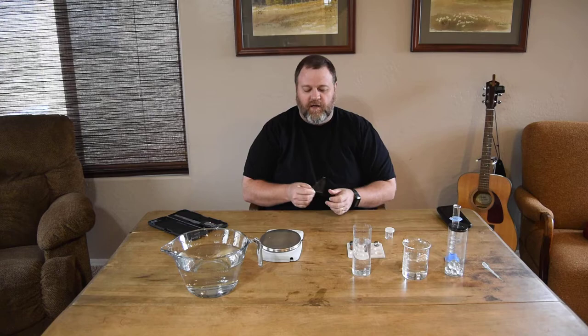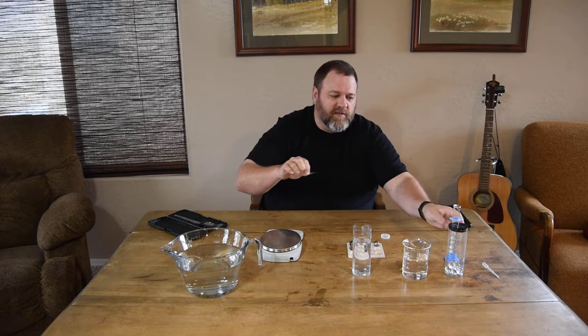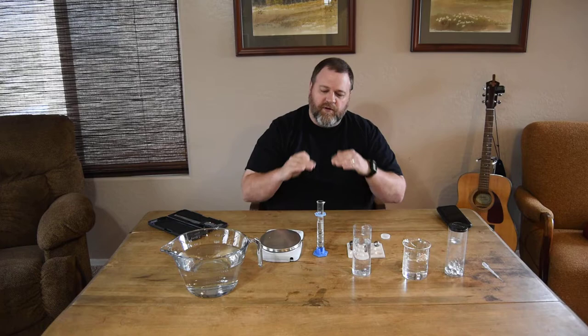If you have a very large piece of glass at a crime scene, like this piece of glass here, you could use Archimedes' principle or volume displacement to determine its density. The problem though is that quite often at crime scenes we don't have really big pieces of glass. Quite often what we have are trace pieces or very small pieces of glass. The problem with figuring out the density of a really small piece of glass using volume displacement or Archimedes' principle is that if you place it into a cylinder, the volume doesn't change that much, so you get very inaccurate and imprecise measurements.